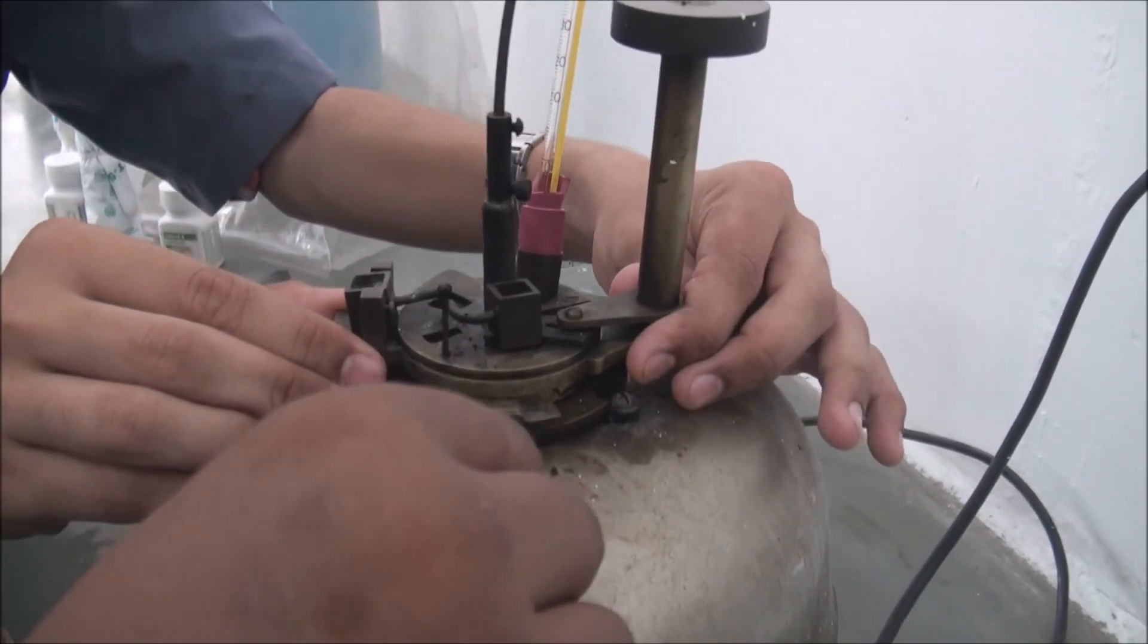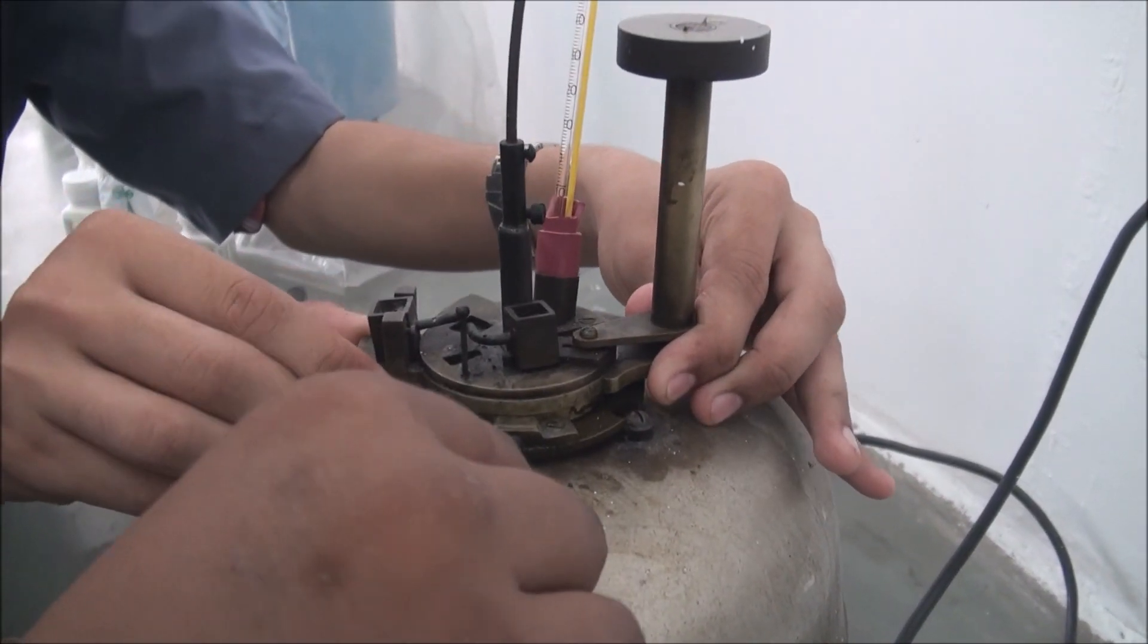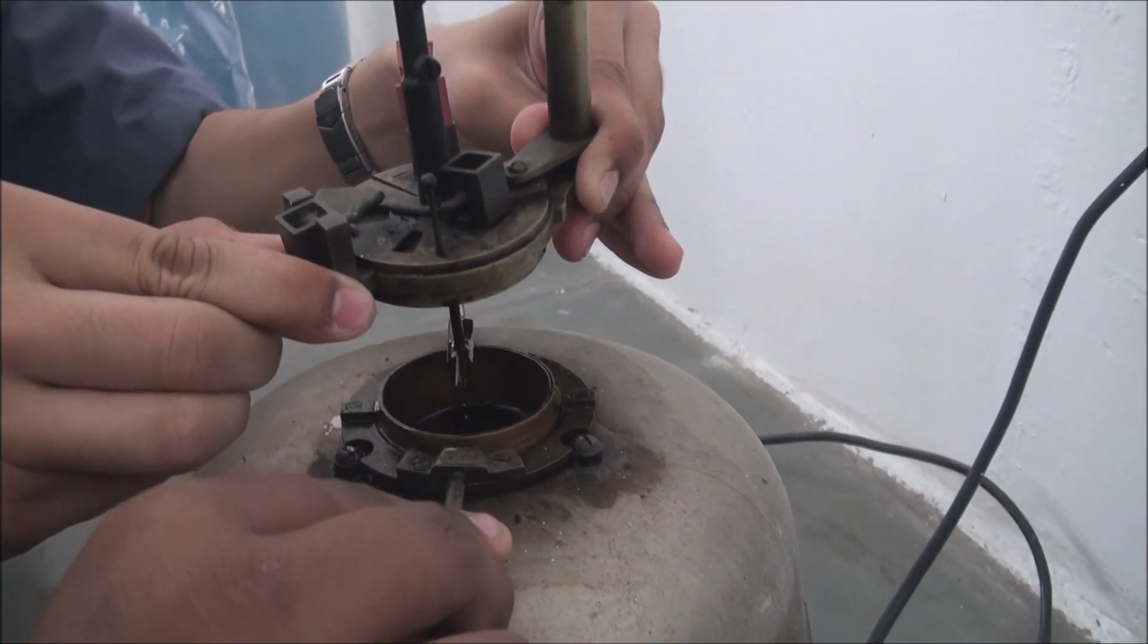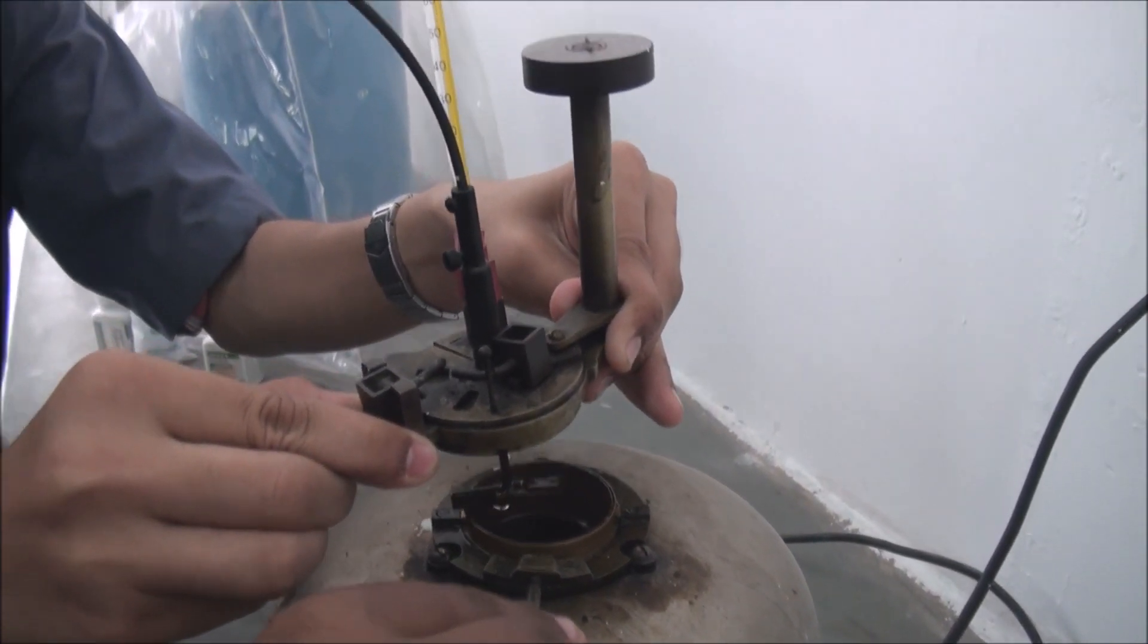Here the working of handle is shown. Also, the lubricant can be seen after removing the upper lid. The lubricant we have used for this experiment is Diesel.